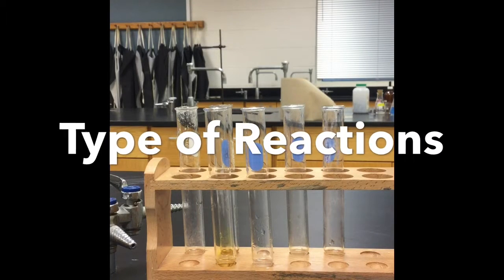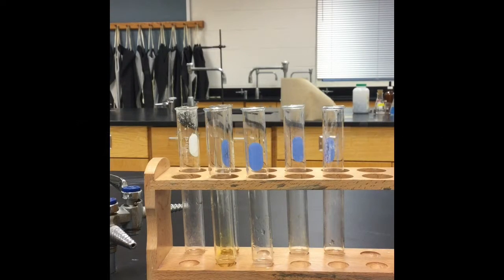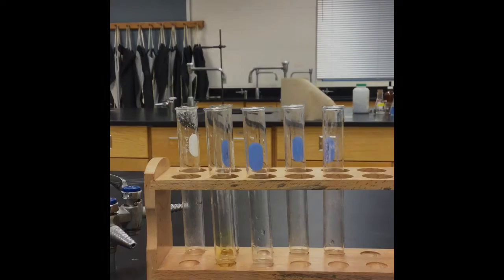Today we are going to do the type of reactions lab. In this lab there's 9 little mini procedures, so we're going to see 9 different types of reactions. So let's see the first one.